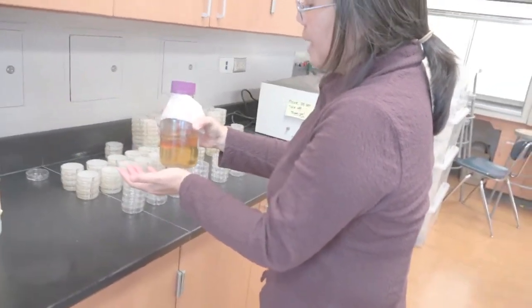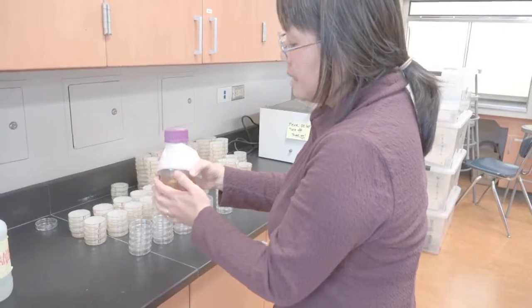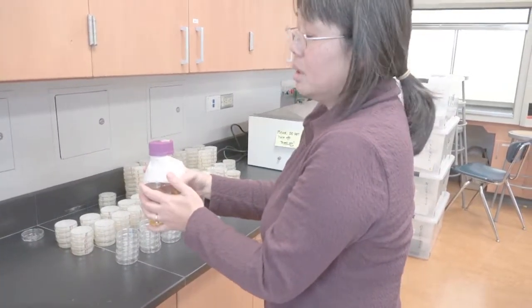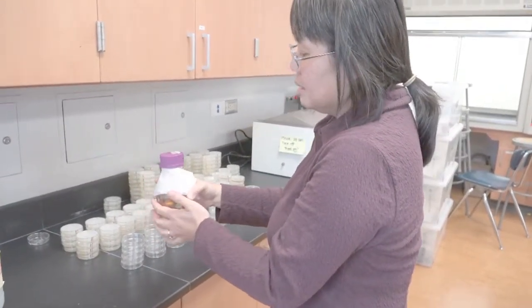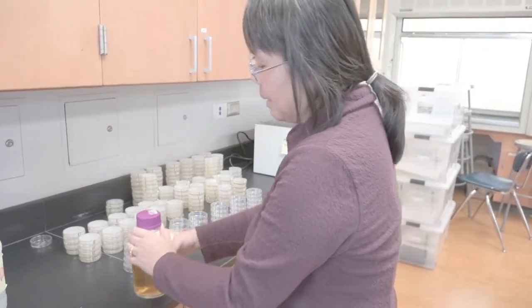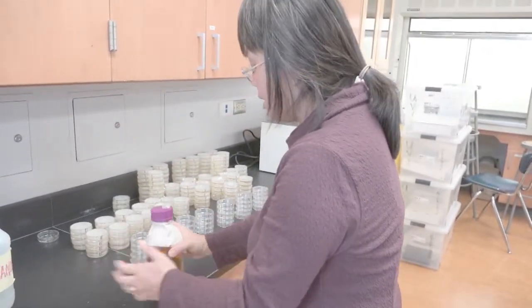Now this is ready, and our bottle is cool to the touch. I want to reemphasize that you want to add your Ampicillin and Arabinose to cooled LB agar. If you pour it when it's hot, it's going to deactivate or ruin your Ampicillin and Arabinose, and it won't work.